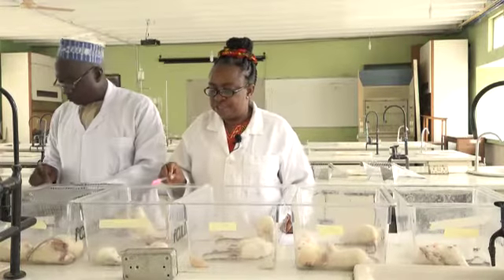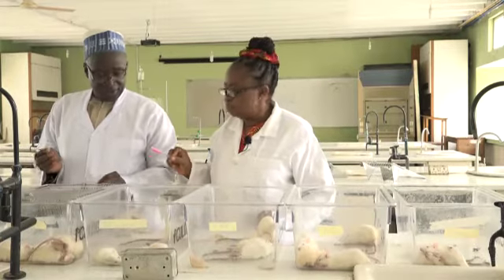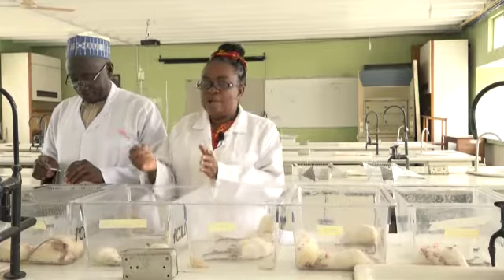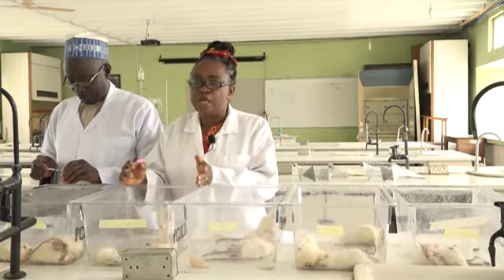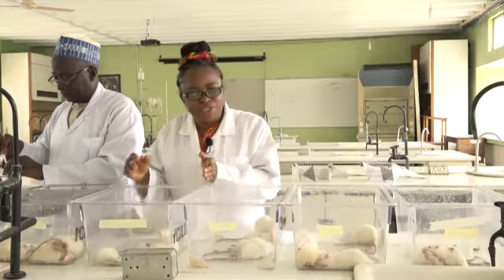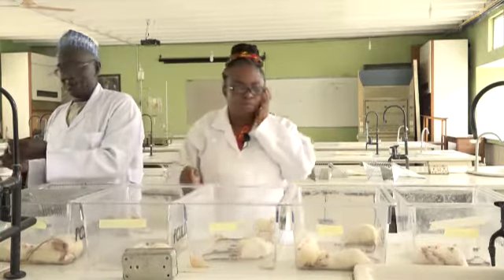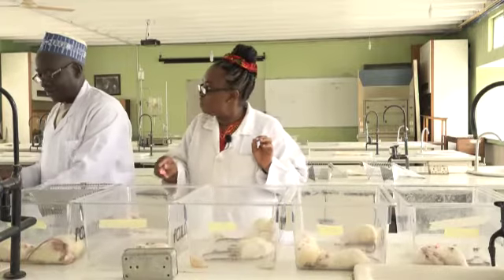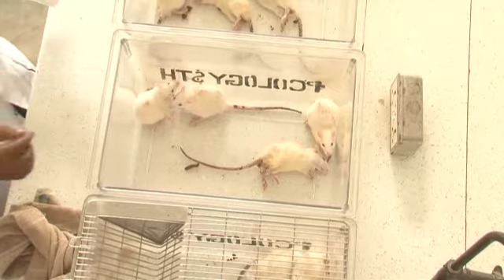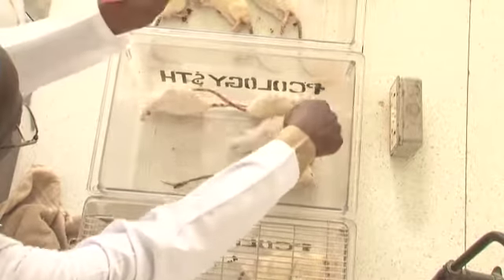Now, in this cage, you are still giving the poison. Immediately after the poison, I will give the antidote. Okay, but you are still giving the poison. Yes. Now, look at this. In this cage, you have male rats. They are being poisoned. No antidote has been given. And yet, one of the rats has already succumbed. I give the antidote now. Oh, you've given the antidote? Yes. Okay. I apologize. I was busy talking about animal rights. The antidote has been given. Immediately he gives the poison, he gives the antidote.